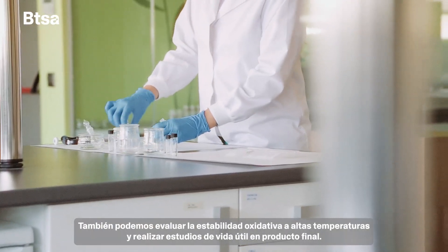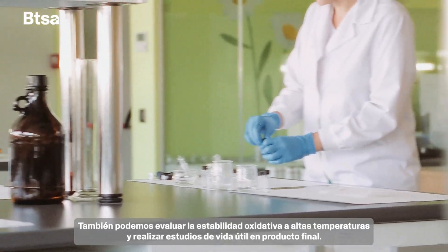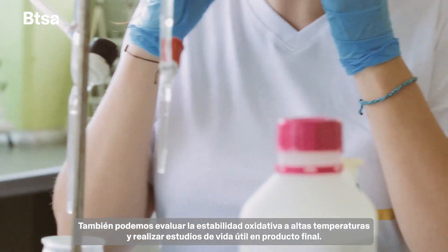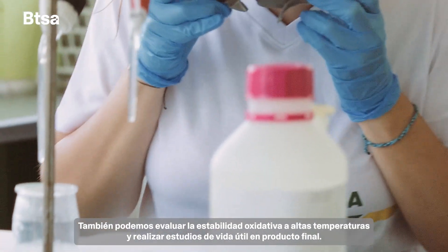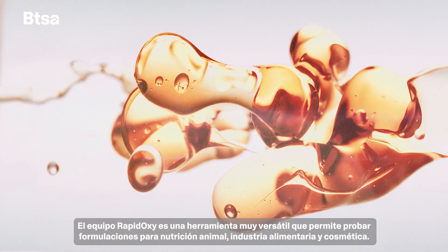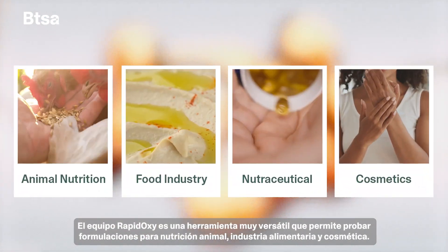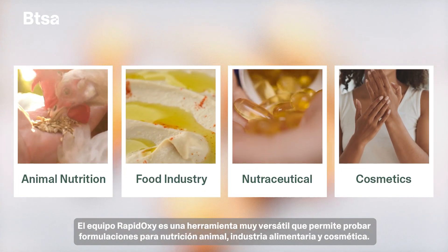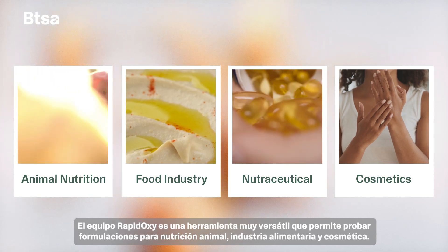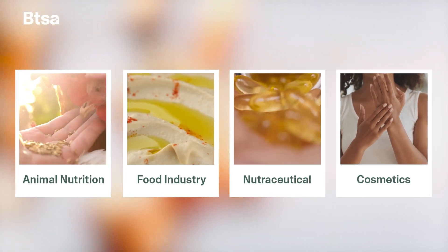We can also evaluate the oxidative stability at high temperatures and carry out shelf life studies of final products. The rapidoxy equipment is a versatile tool for testing formulations for animal nutrition, the food industry, nutraceuticals, and cosmetics.